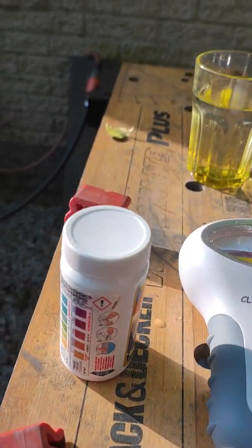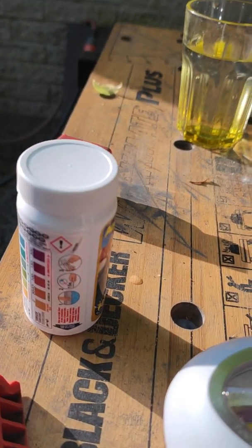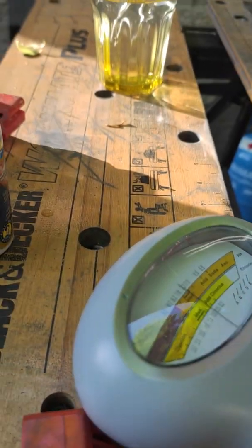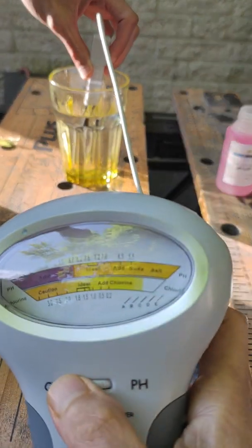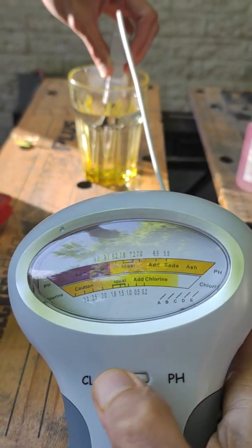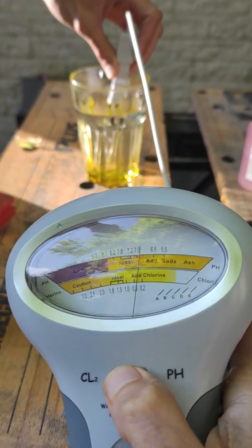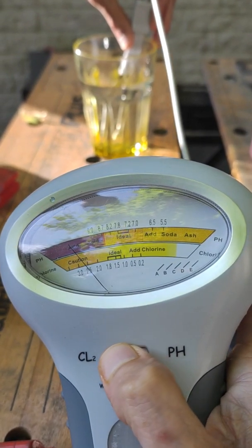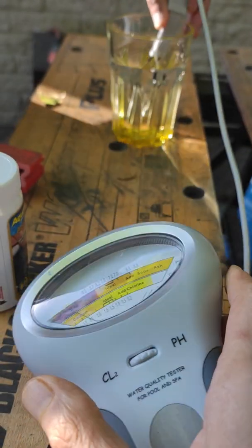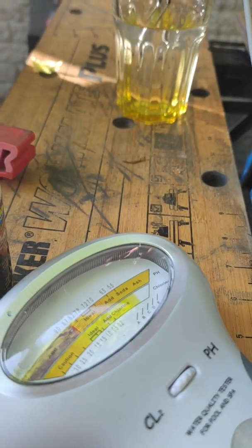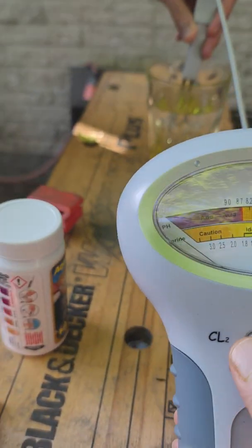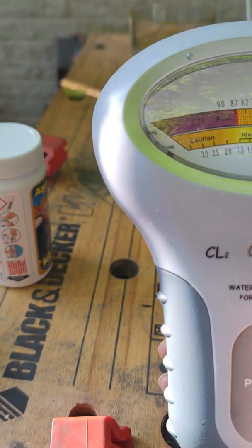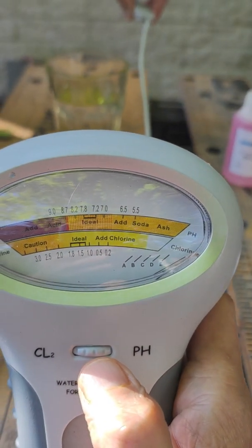Now if I use your meter, turn it... I can't even calibrate it, but just hold it here like that. Yeah, that's good. So turn it on. I can't bring it to three. Okay, remove it. I cannot calibrate it at all.